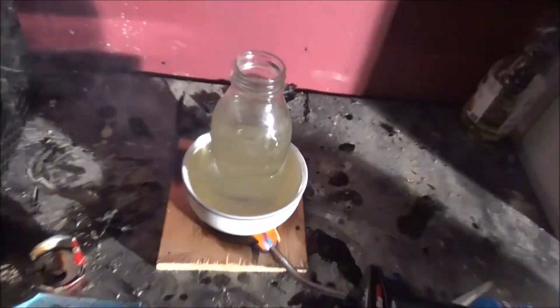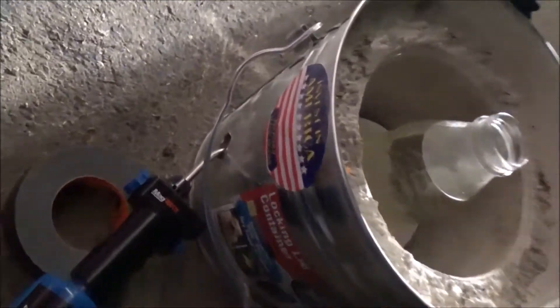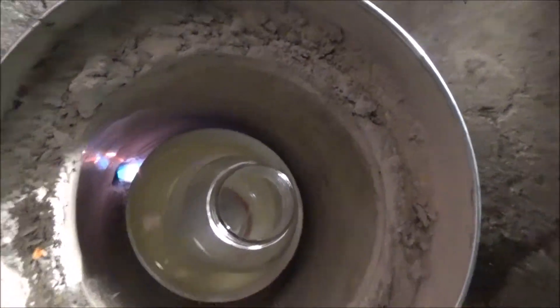There's actually moisture coming out of this. I'm using my new foundry — I haven't even used it once yet. I think this is the preheat, so I'm just putting my blowtorch in the air pipe.